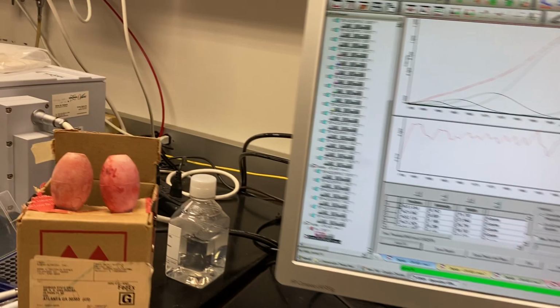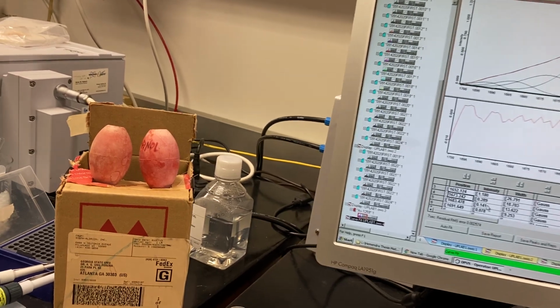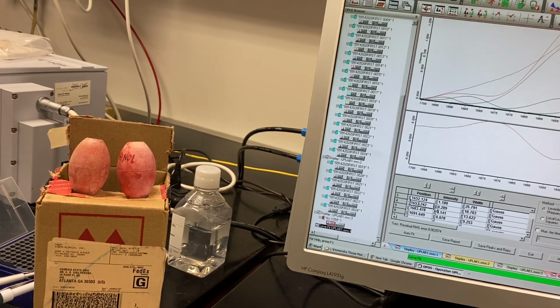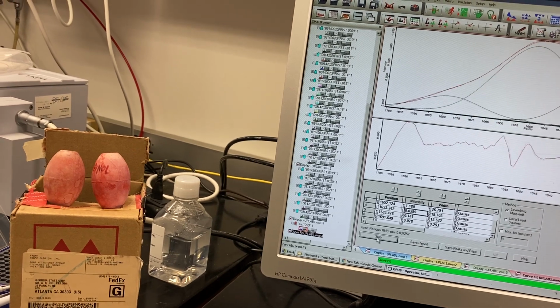Still this is not working, so 0. The position should be approximate to the information you got from the minima of the second derivative curve.